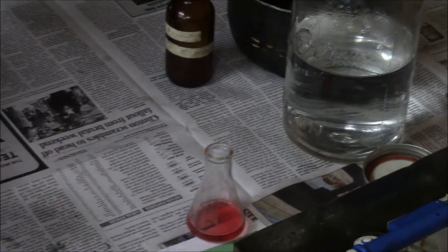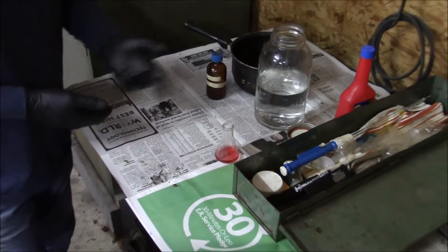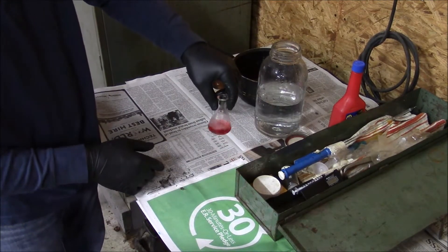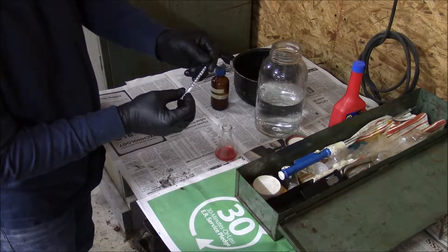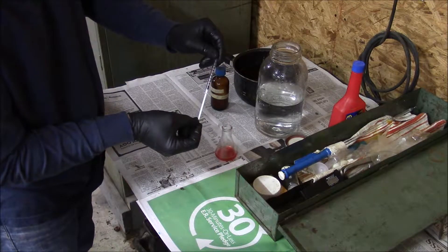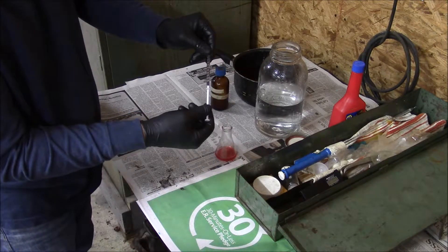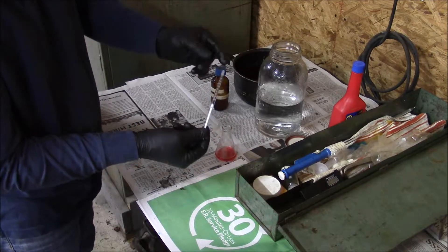The titrating solution is only good for about three months. Being that it's only distilled water and lye — just a little bit of lye — there's really no reason not to make a new batch every three months or so. Now we've got our prepared solution ready to accept the oil. I have these called oral syringes — for giving babies medicine. I got these at the drugstore. I need one milliliter of product and this is a one milliliter oral syringe.